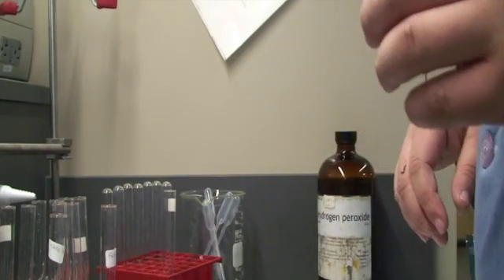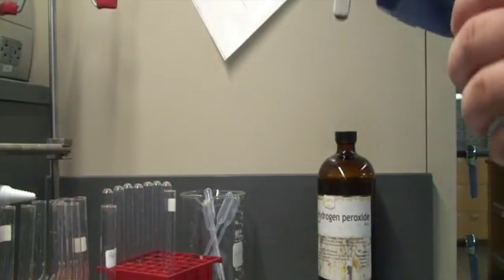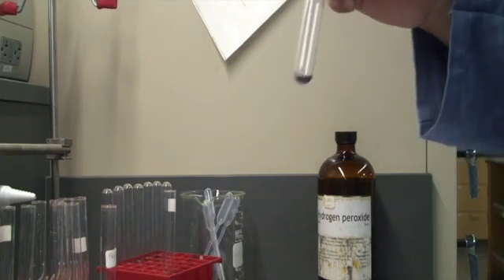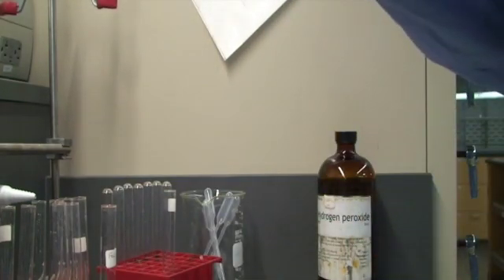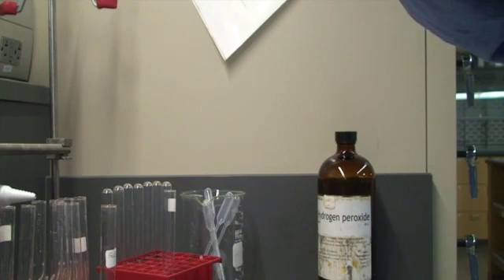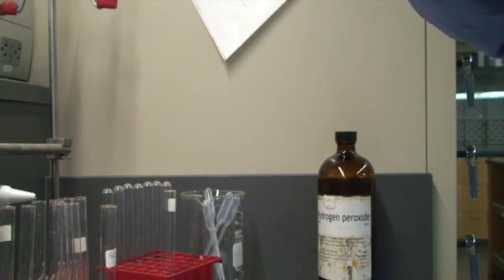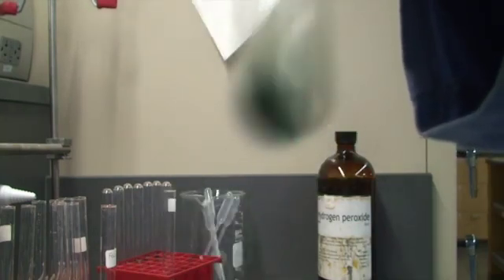The first thing we're going to do is add a few drops of chromium(III) nitrate. You can see it's a dark blue color there at the bottom. Before we add our peroxide, I'm going to add about 20 drops of NaOH. It went from that dark blue color to now a little dark green, and there's a little bit of a precipitate down there.